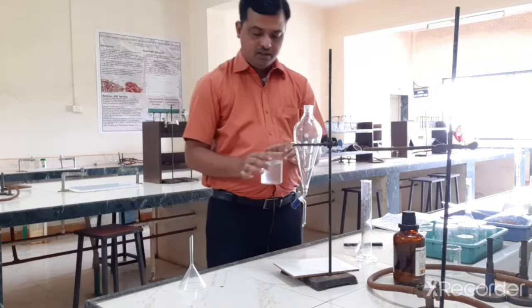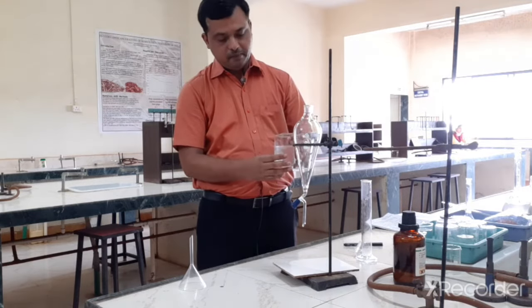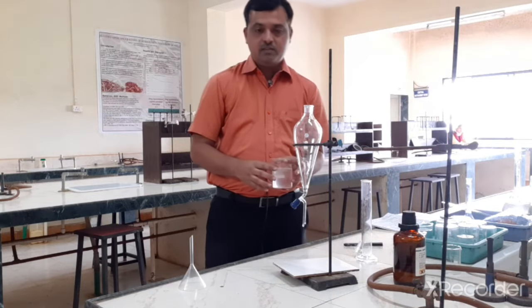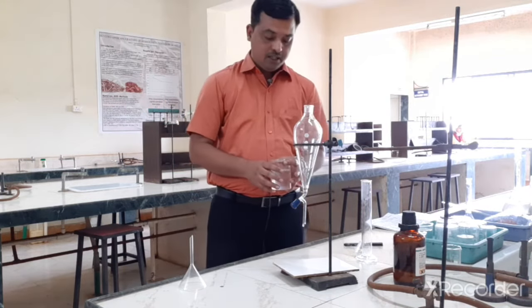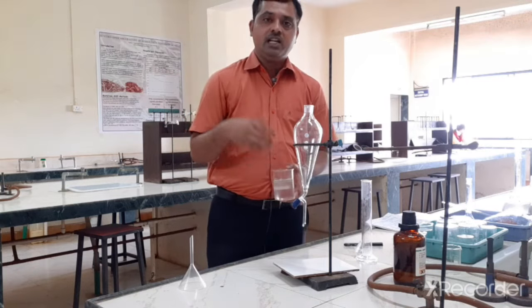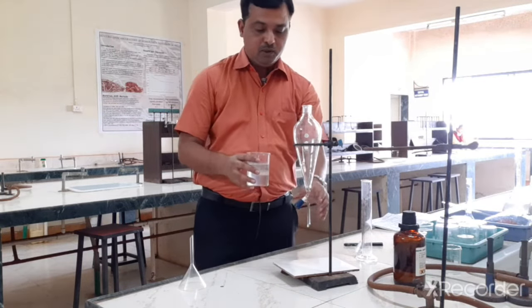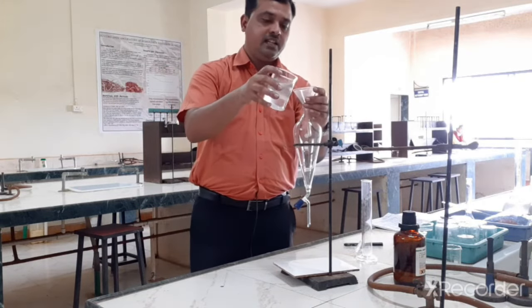Now we have separated the trimethoprim into a chloroform layer, but this is an organic phase. So this phase we cannot use for recording an absorbance in UV spectrophotometer. Now we are going to take back our trimethoprim, which is now present in this organic layer, into an aqueous layer. Okay, so we know that trimethoprim is a basic drug, so it will get ionized in acidic pH.